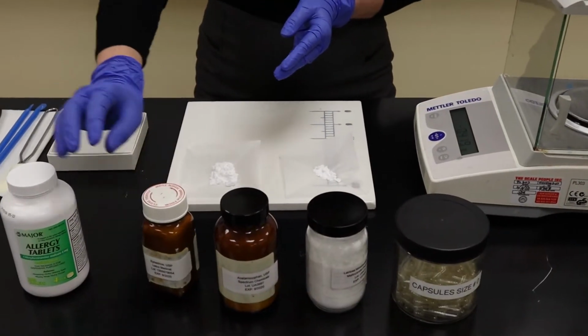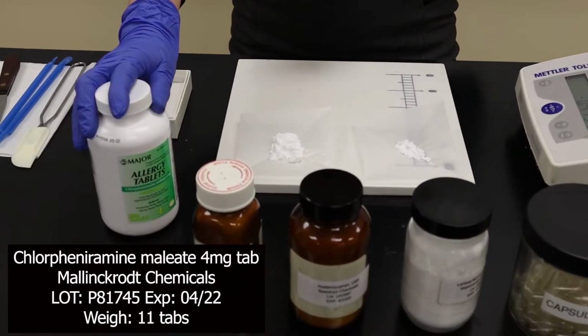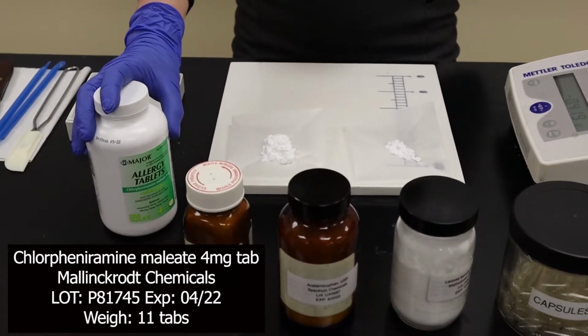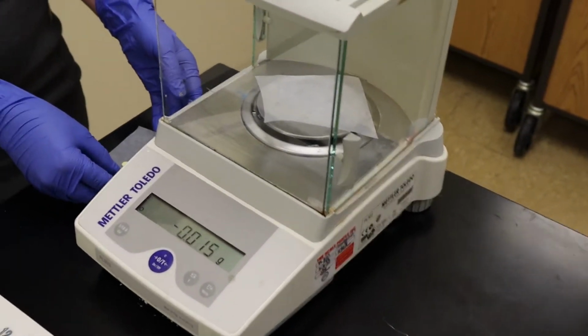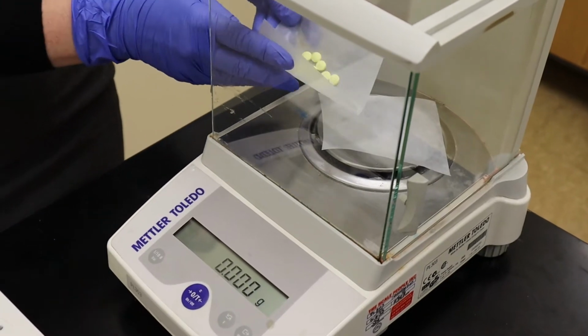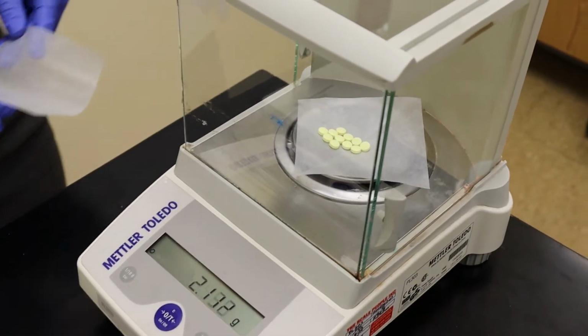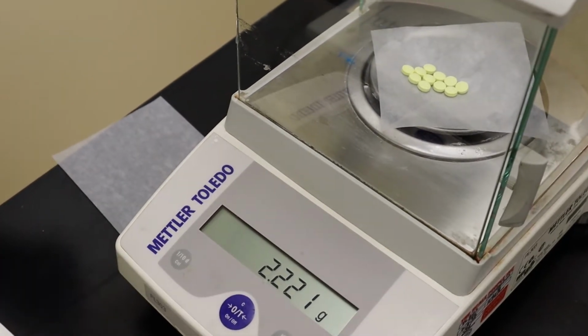Now that I have my ephedrine and acetaminophen weighed out, next I'm going to weigh my chlorpheniramine. Since my source of chlorpheniramine is a 4 milligram tablet and I calculated that I needed 42 milligrams of chlorpheniramine, or 10.5 tablets, I'm going to weigh 11 tablets and then calculate how much of the resultant tablet powder I need to weigh in order to obtain the desired 42 milligrams of chlorpheniramine.